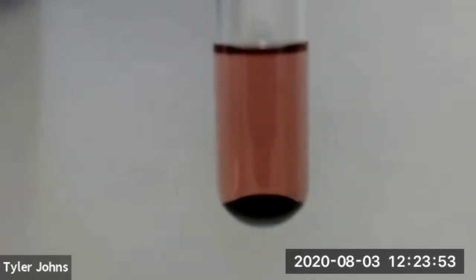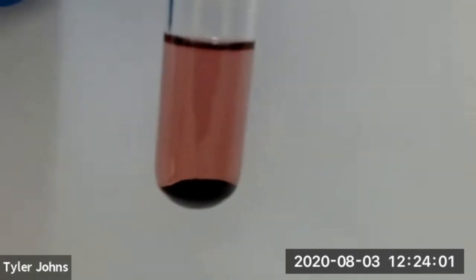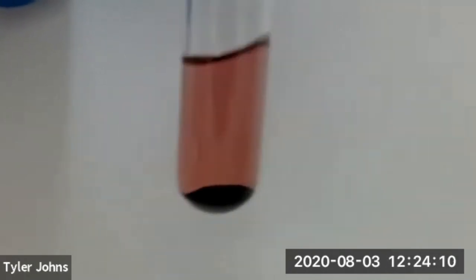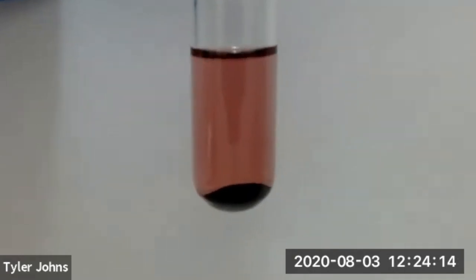This is our mixture of tetraphenyl cyclopentadienone and methanol after 60 seconds of shaking. You need to determine whether the tetraphenyl cyclopentadienone is soluble, partially soluble, or insoluble in the methanol and explain your answer. This concludes part E of this experiment.